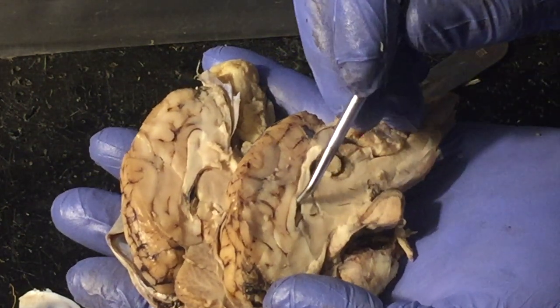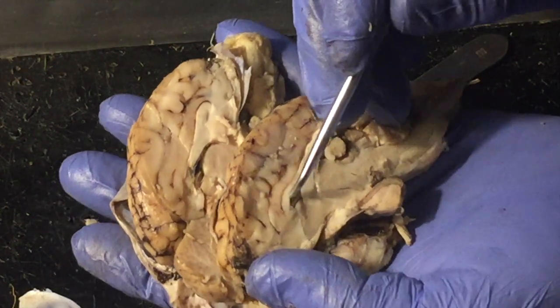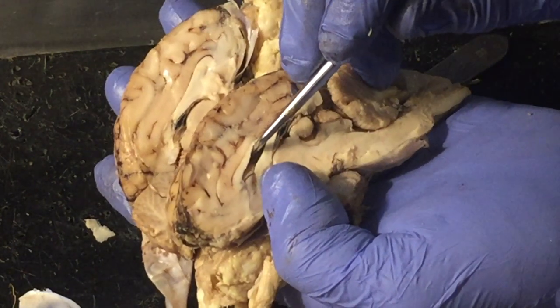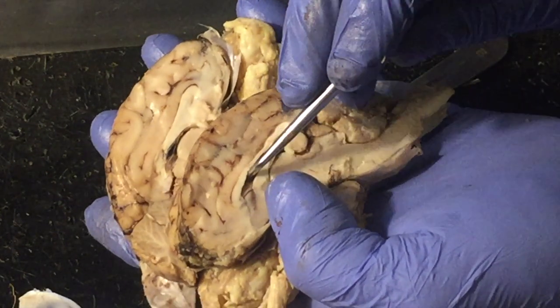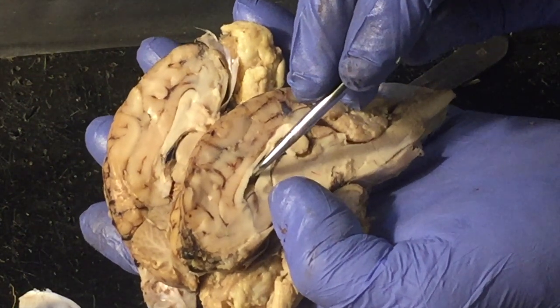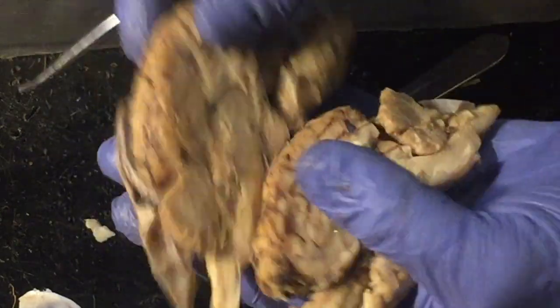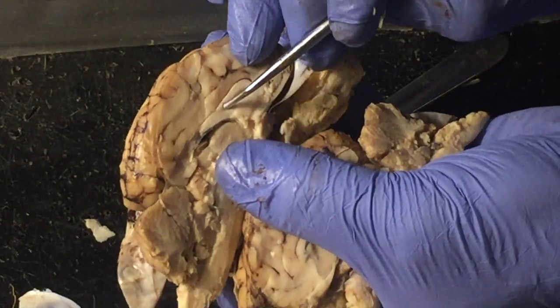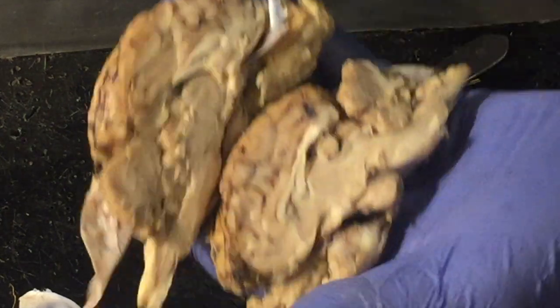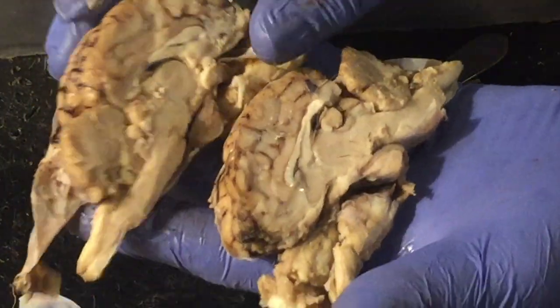Right here I wanted to point this out though. This is the corpus callosum, and I'm going to sort of pull the two parts apart just a bit, and you can see right there there's a space. Is that showing up good, Ben? This is one of the ventricles of the brain, and this is, among other things, where cerebrospinal fluid is produced. Okay, there's one on one side. On the other side, we would find the other one right in there. So that is the first and second ventricles, or the lateral ventricles.